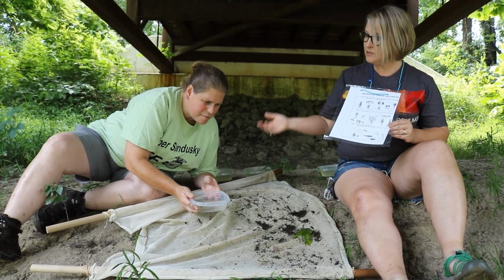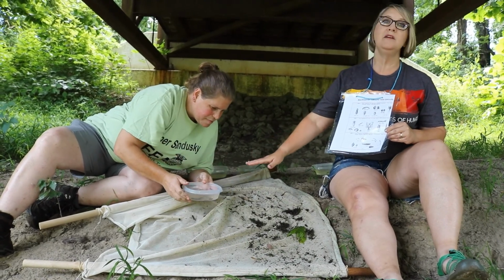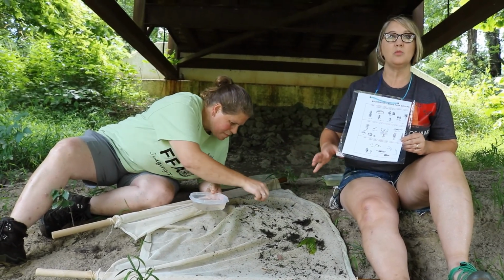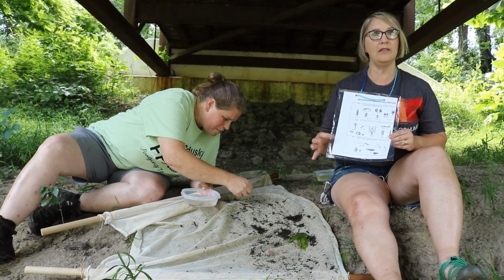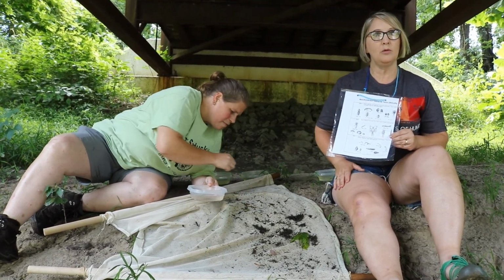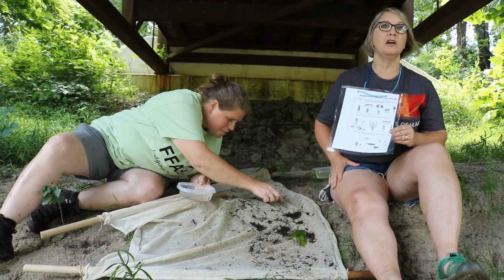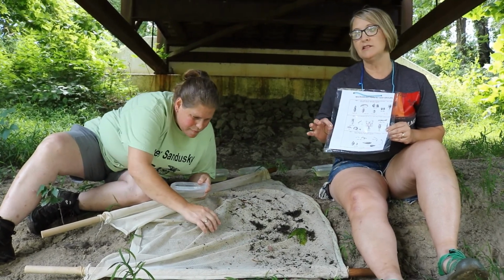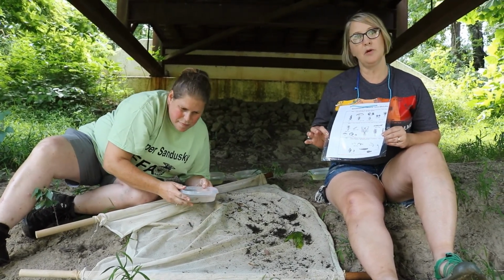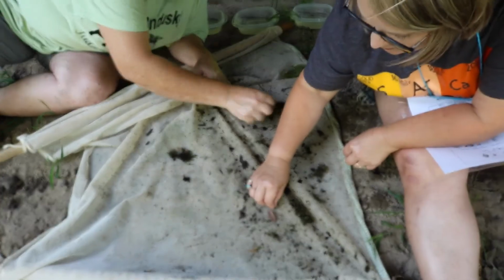Now, what we see Mrs. Cresswell doing is looking through here, and she is dropping them into these tubs that are labeled as 1, 2, and 3. So if we know what they are right away, we can go ahead and start sorting them by their taxa group, get them back in the water so we can take a closer look and look at our numbers. If we're not sure, there's one with a question mark, and then we can take a little closer look at some of our photos and our examples that we brought with us to identify those macroinvertebrates.